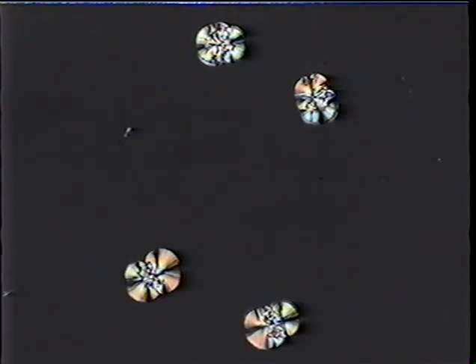We'll look for a reasonable spherulite to watch for a minute to see how it fully develops and begins to grow as a circular spherulite. A few there, but that's a little better.